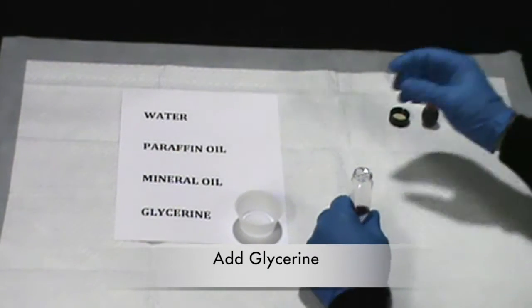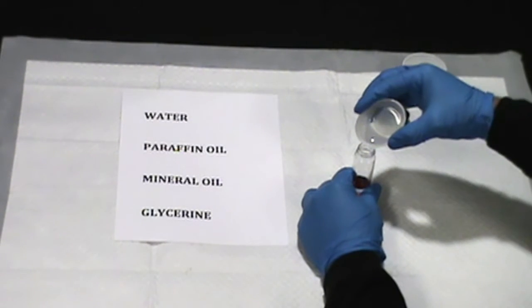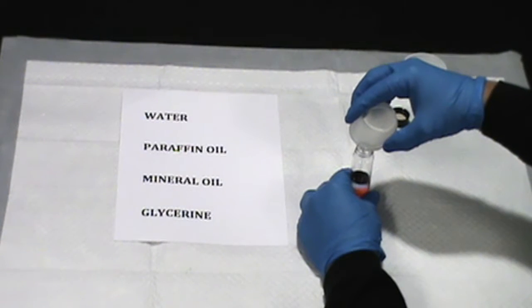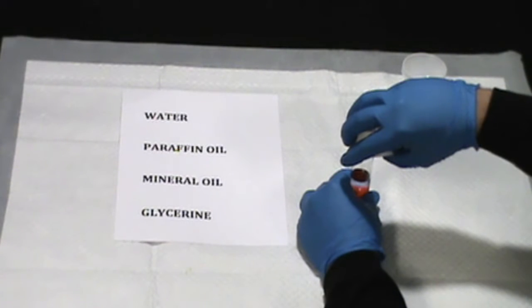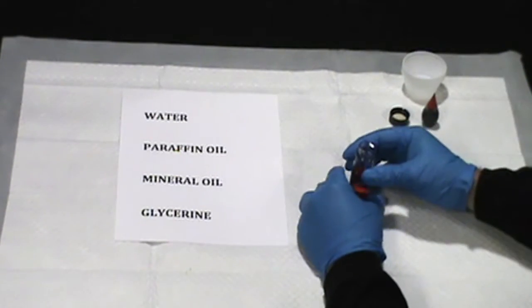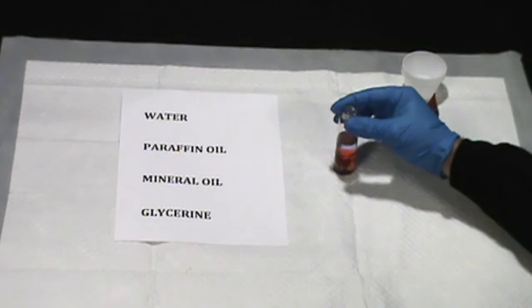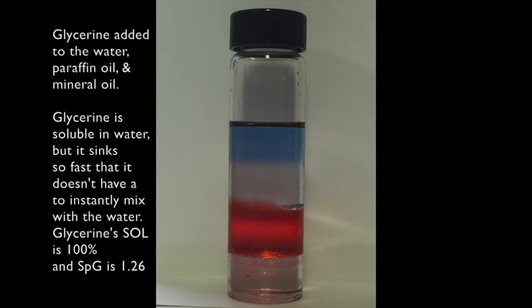Now we will add 10 milliliters of glycerin to the glass vial. The glycerin is the clear layer on the bottom of the vial.